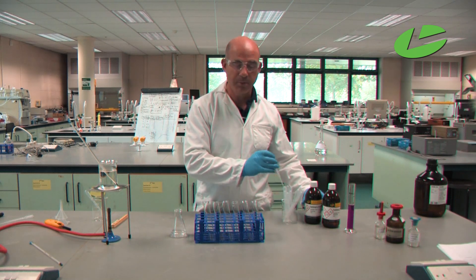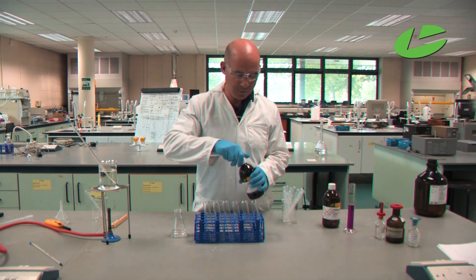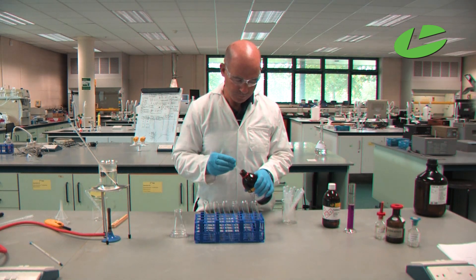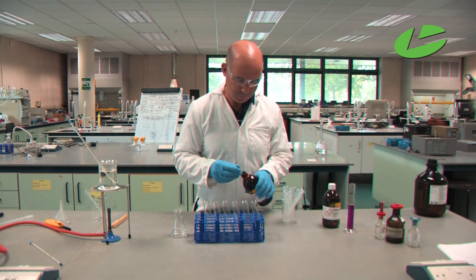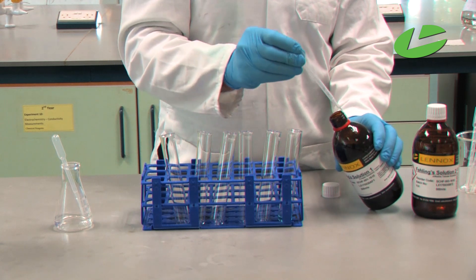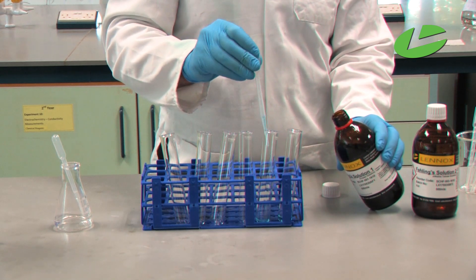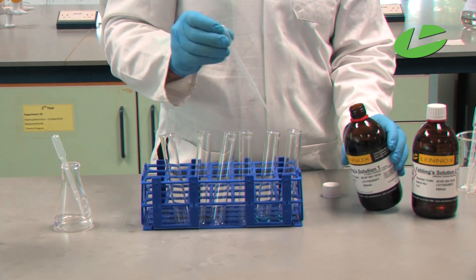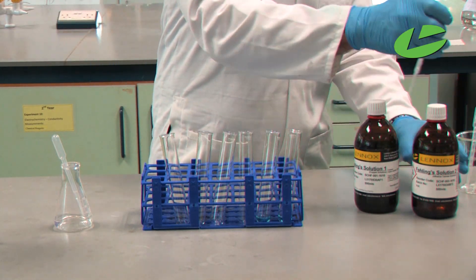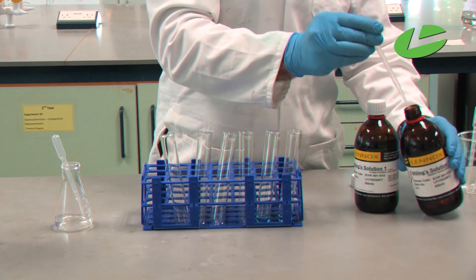First of all, to make Fehling's solution you add equal volumes of Fehling's one and equal volumes of Fehling's two.